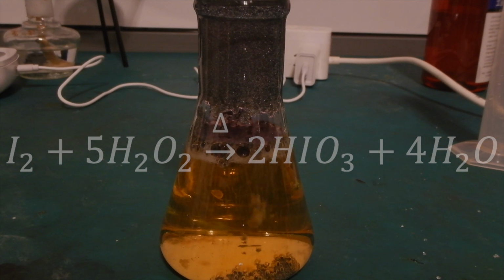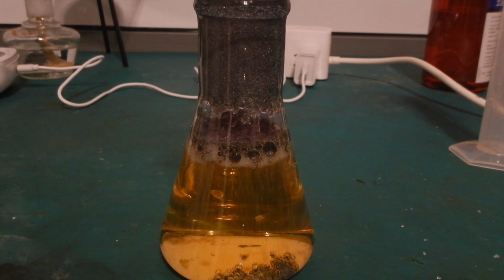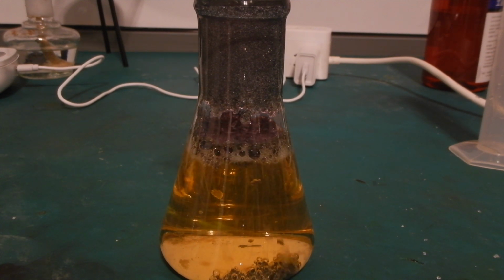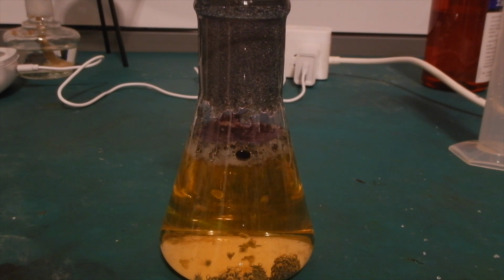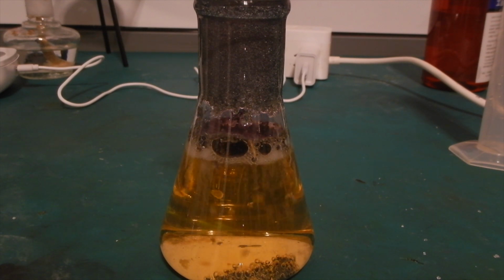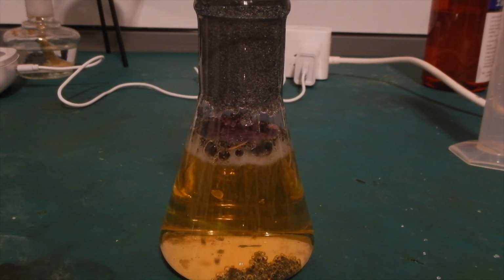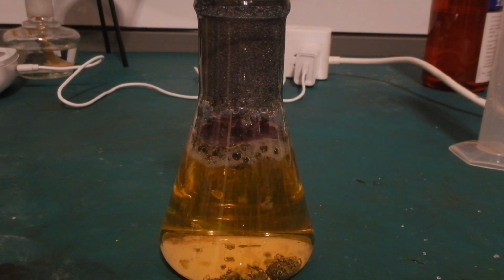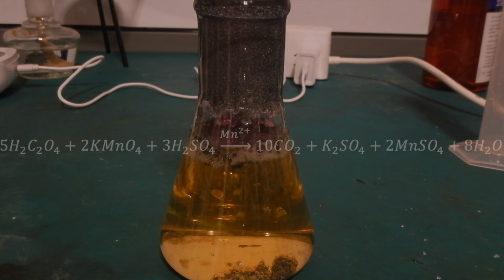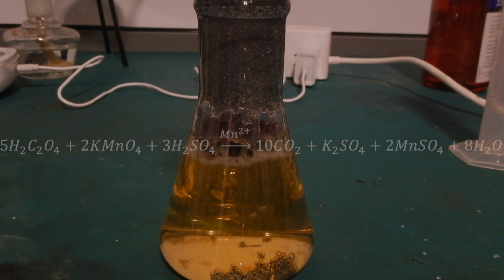In this reaction, hydrogen peroxide oxidizes the iodine to iodic acid. Hydrogen peroxide only has a strong enough oxidizing power in acidic environments, which is why I added the initial amount of hydrochloric acid. However, the iodic acid generated is also a strong acid, and so the reaction can catalyze itself repeatedly. This is called a self-catalyzing reaction. Other examples of this include the reaction between oxalic acid and acidified potassium permanganate. The manganese ions produced will catalyze the reaction and make it go faster.